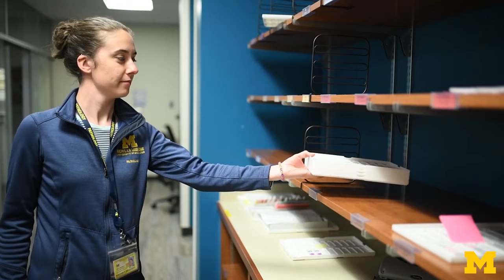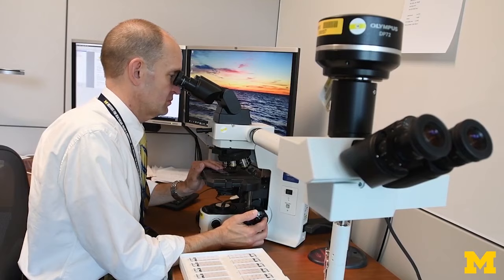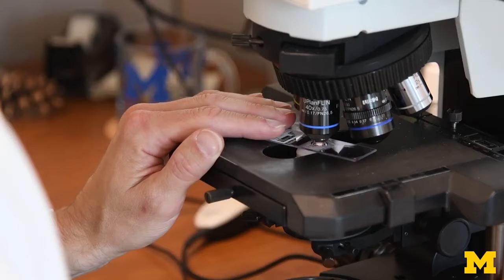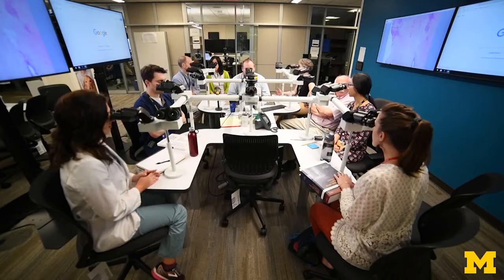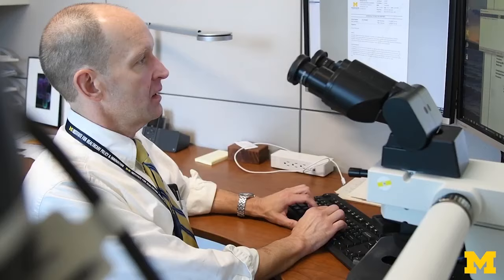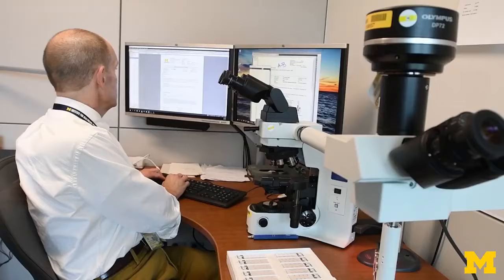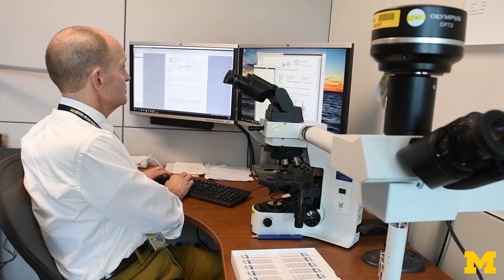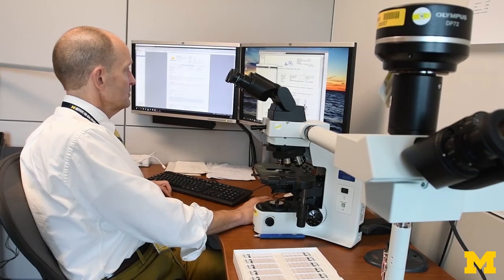Slides are organized by patient and organ system subspecialty and assigned to a pathologist to be examined. Typically, a single pathologist will diagnose a biopsy and generate a report, a process known as signing out. In particularly difficult cases, the pathologist may share the slides with expert colleagues in order to arrive at a consensus diagnosis. The results are reported in a succinct pathology report that is uploaded directly to the electronic medical record. The patient's primary care doctor, surgeon, or specialist can then access the results and deliver them to the patient in order to discuss the next steps to be taken.